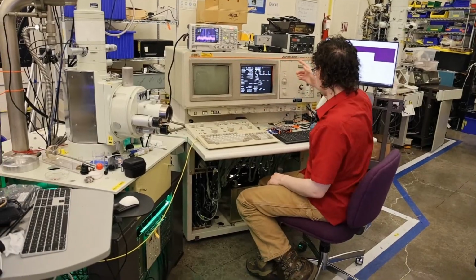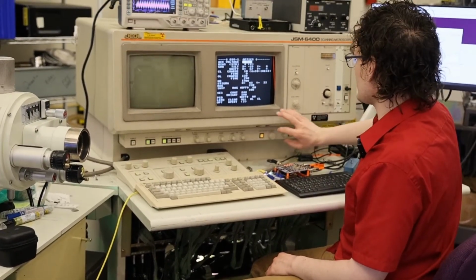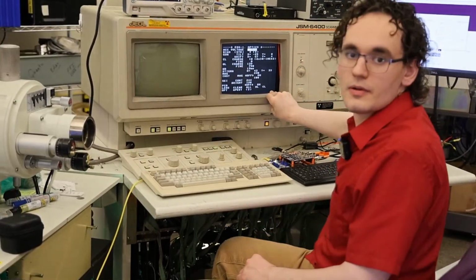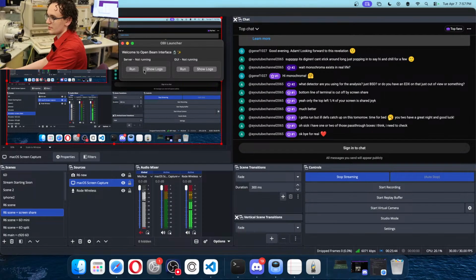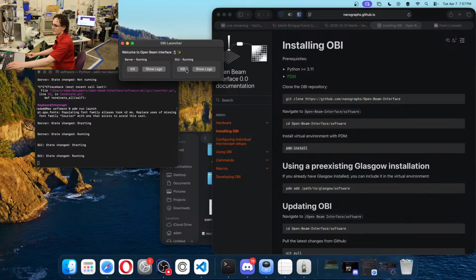So we're at 15 kV, filament current knob is 0. So we're going to go ahead and turn high voltage on. And now I heard it. With high voltage on, we can go back to our screen share real quick. We're going to run our server. We're going to run our GUI.